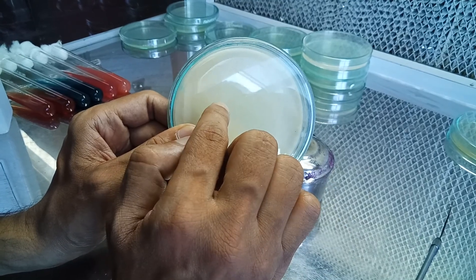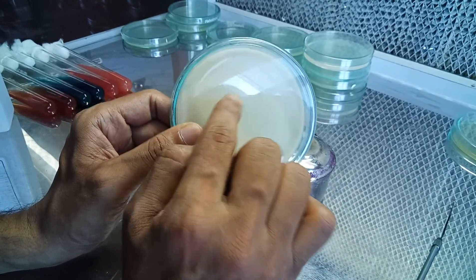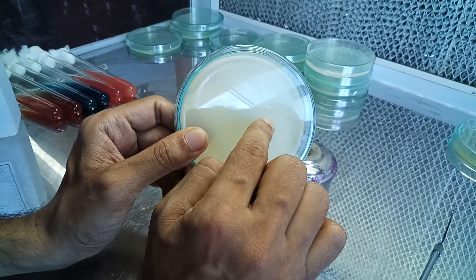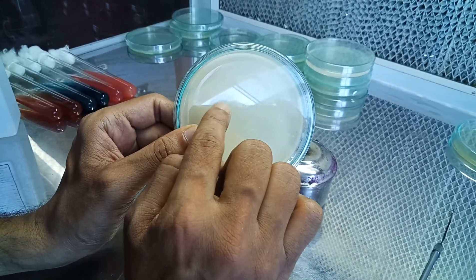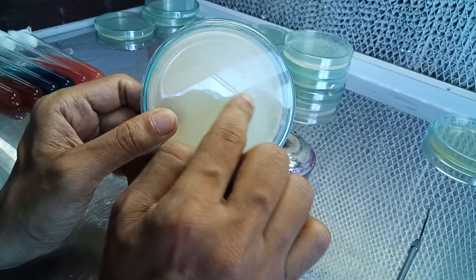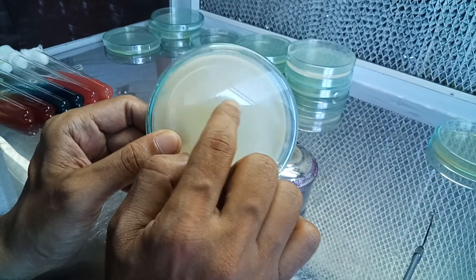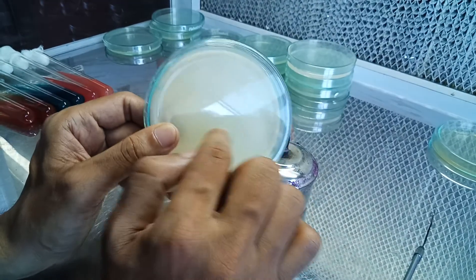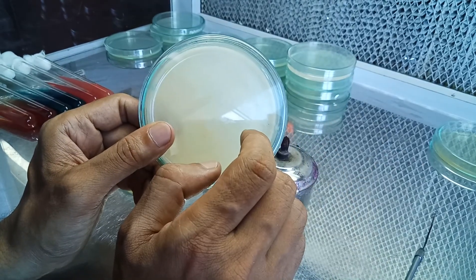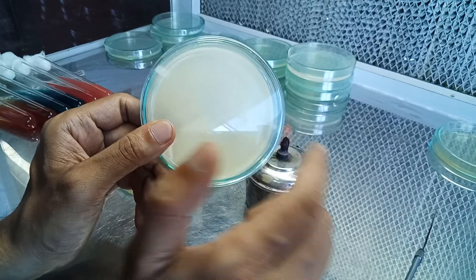To interpret the result: a clear zone of lysis indicates casein positive; bacterial growth with no zone of lysis indicates casein negative. We will now incubate the plate and after 24 to 48 hours at 37 degrees centigrade, we will observe whether there is a clear zone to call it casein positive or no such zone to call it casein negative.